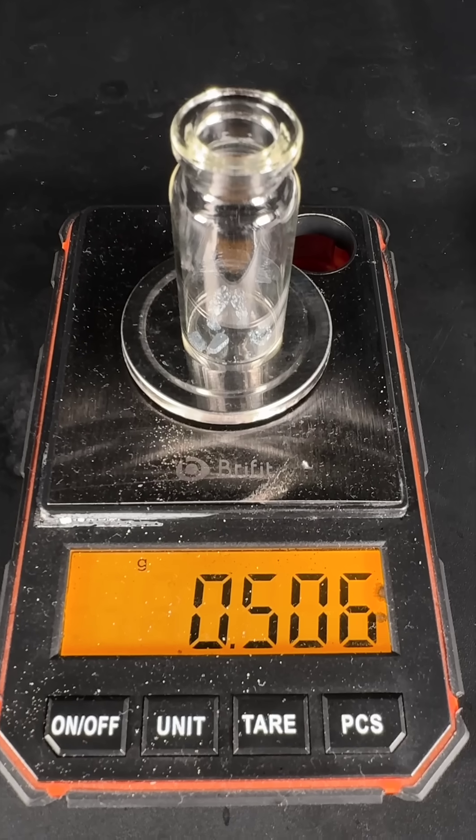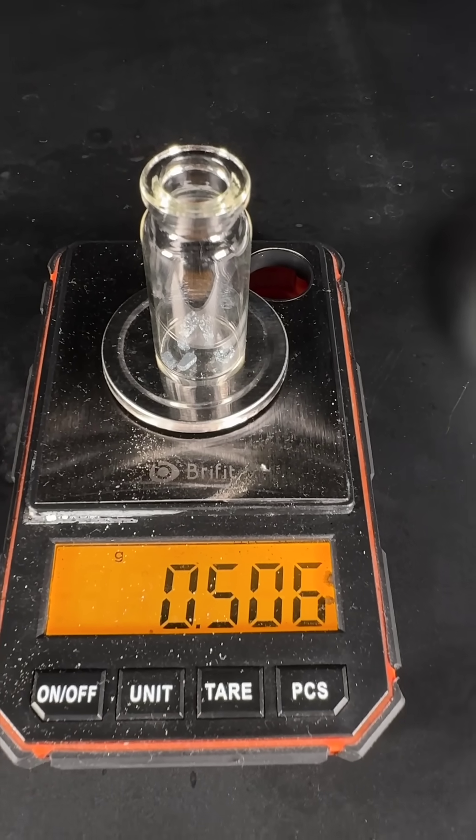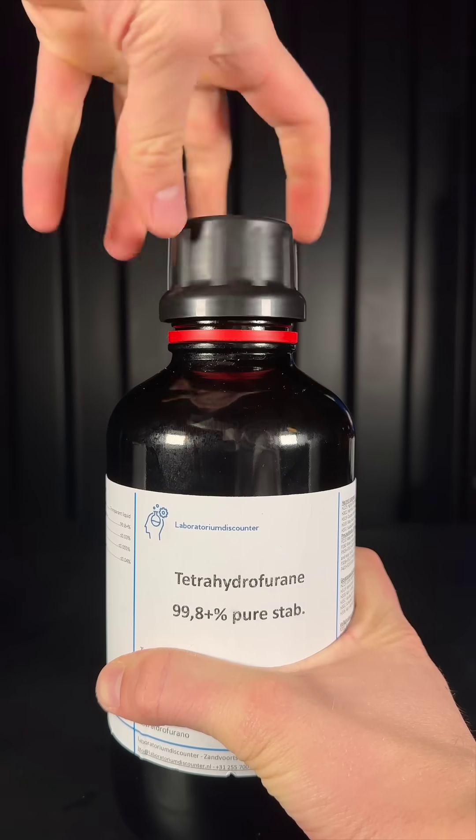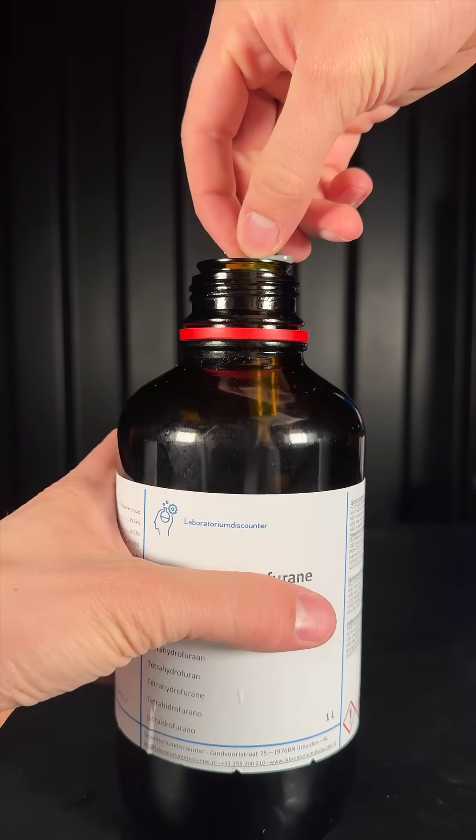I began by adding 506 mg of iodine to a pre-dried vial. The amount of iodine I used is required for less than 1 ml of the Grignard reagent.